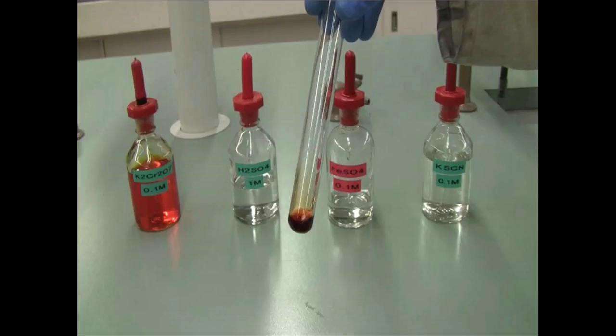For section C, when we're looking at the way that ligands interact with metals, there are some very common patterns and themes that run throughout the experiment. If you have a look again at the theoretical overview in this video, it should help you to start predicting what you might see for each of those reactions. And finally, for your redox section, there's space specifically set up for you to predict what you expect to see with your 6 test tube reactions, and you could also be set up and ready to calculate cell potentials and use the Nernst equation in order to calculate your non-standard cell potentials before you get to the lab.